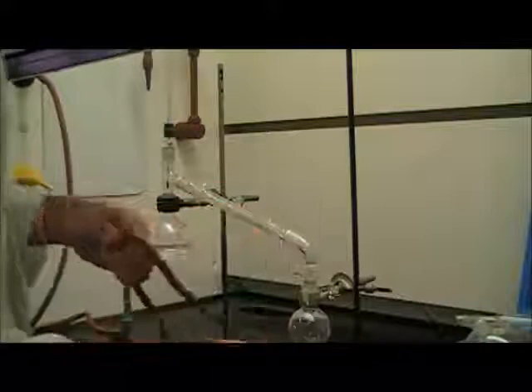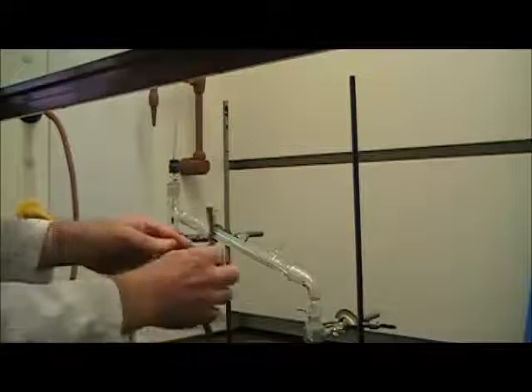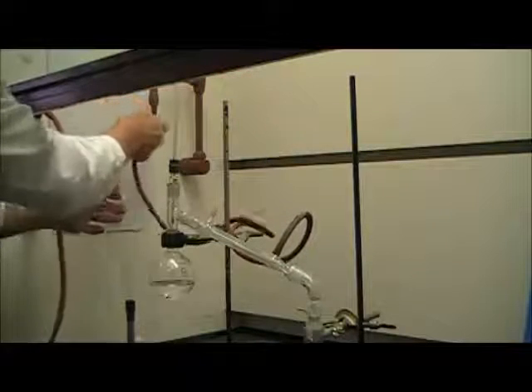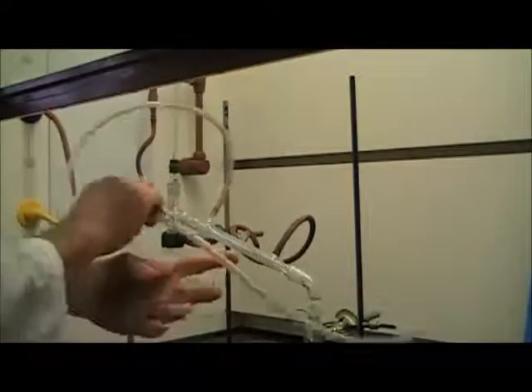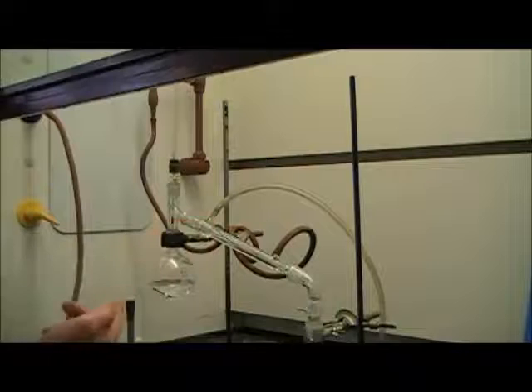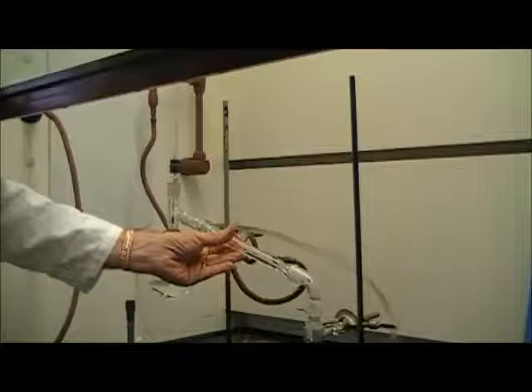Then I'm going to use my two pieces of rubber tubing. One I'm going to attach to the water faucet, and that's then going to go and attach to the lower of the two pieces on the jacket of the condenser. The other one is going to drain into the sink. The reason we do it that way is we want the water to flow uphill in the condenser. When I turn the water on, water comes up from the bottom and out from the top. Now, I have the two ports sort of pointing up in the air. That's fine. Or, once the jacket is filled, we can actually rotate it backwards a little. I believe we're ready to start distilling now.